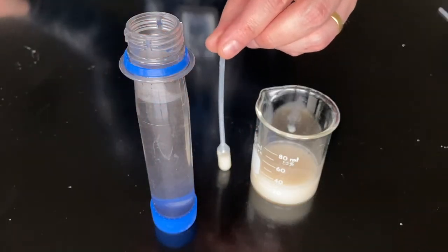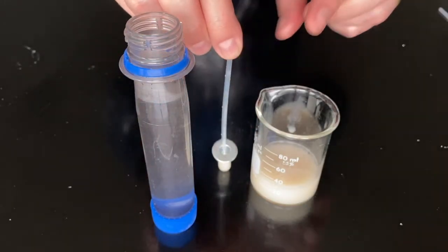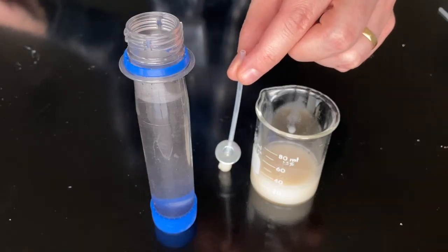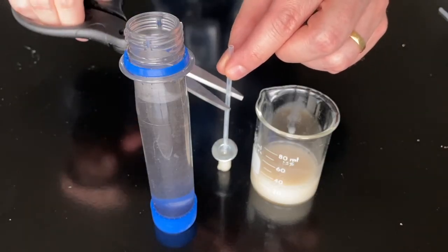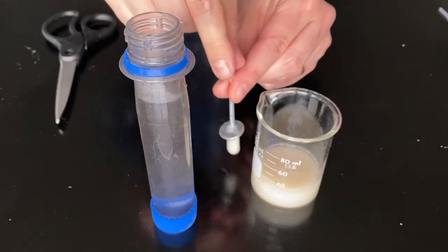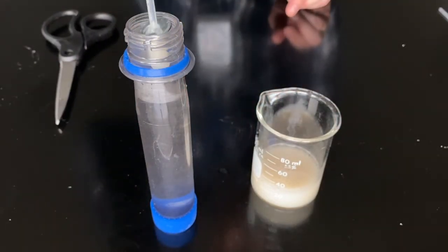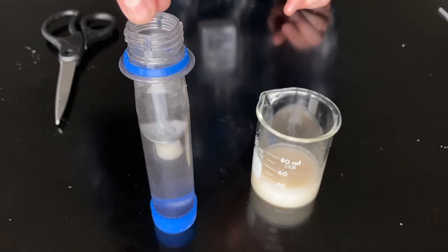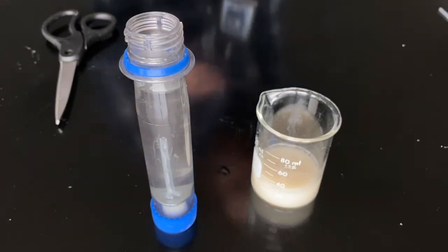Next, place two metal washers around your pipette tube. Then trim the end of your pipette so that the whole apparatus is about three inches long. Drop this apparatus into your test tube. The washers will ensure that your pipette sinks to the bottom and the tip of the tube should be submerged below the surface of the water.